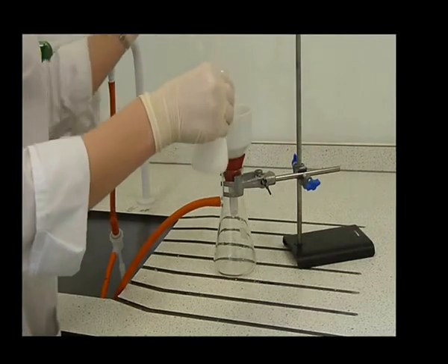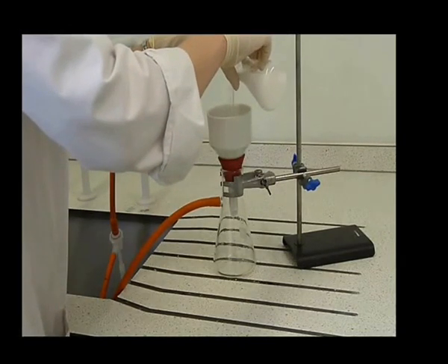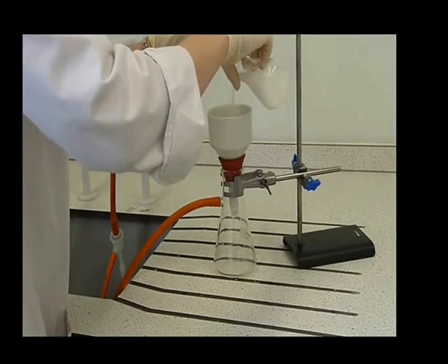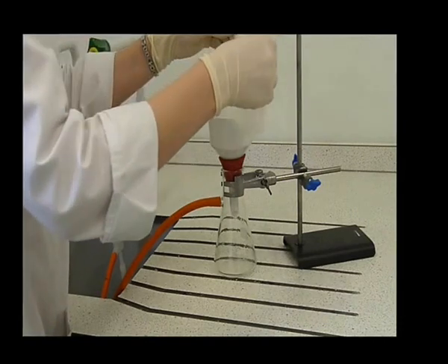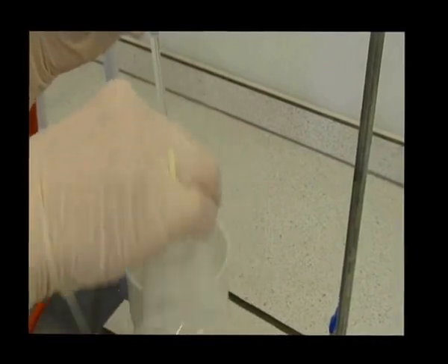Swirl or stir the flask of your impure compound. Pour the content slowly down the glass rod onto the filter paper. Pour at a rate that allows the filtrate to collect in the flask and not in the Buchner funnel. Continue to swirl and pour the entire contents onto the funnel.